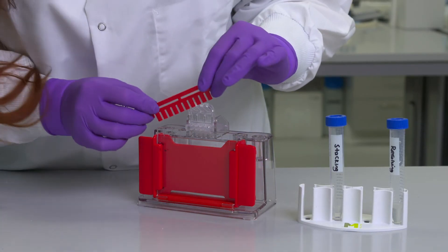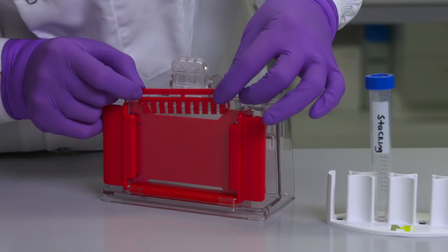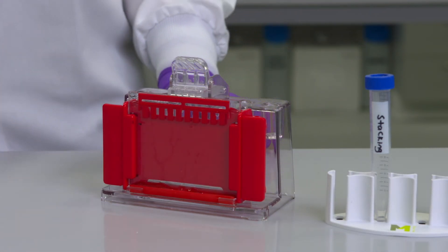Finally I will add the comb to form wells in the gel. Inserting the comb at an angle can help to prevent air from getting trapped under the teeth. Some overflow will occur and this is normal.